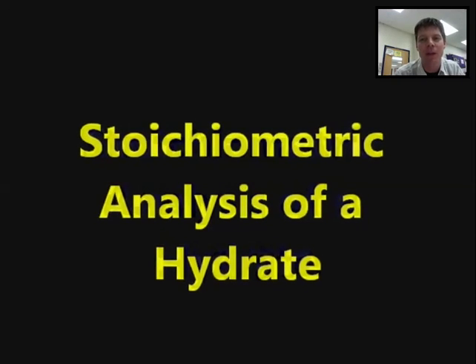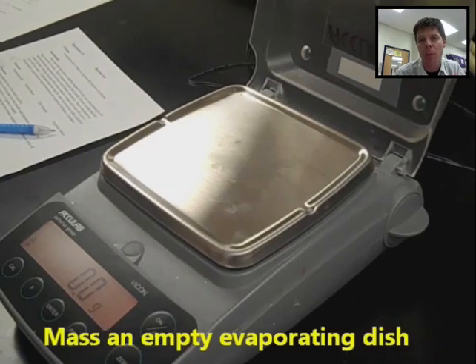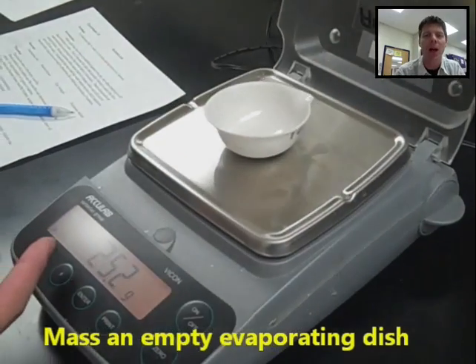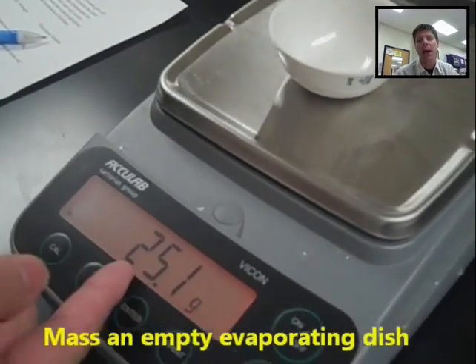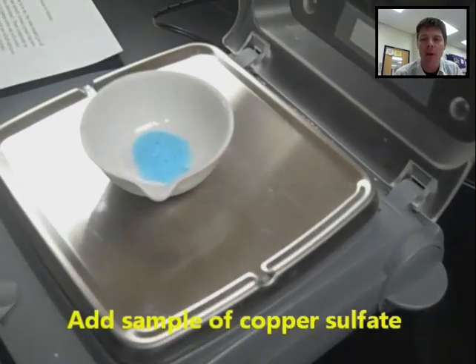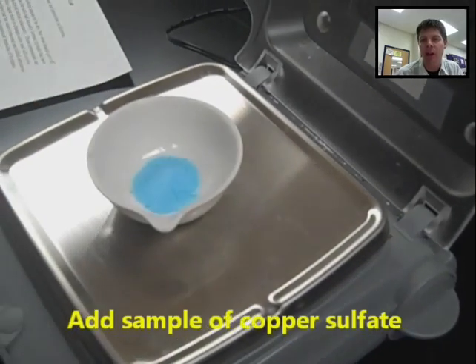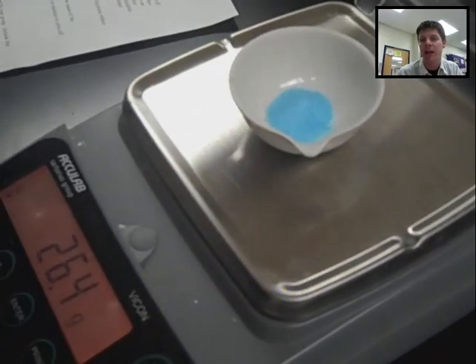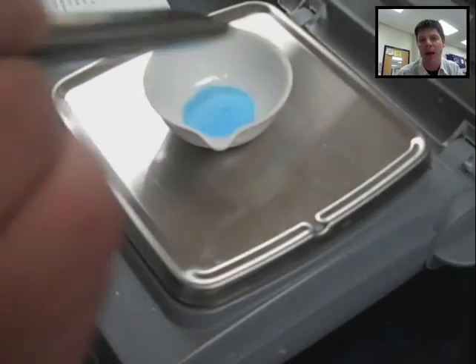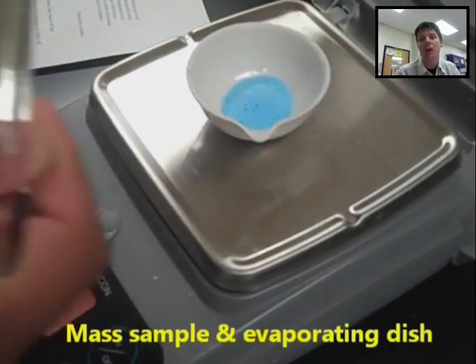Hi everybody, this is a video of a student experiment to do stoichiometric analysis of a hydrate compound. The hydrate the students were working with for this lab was copper sulfate. You can see that the sample is being added into an evaporating dish which has been massed to determine the mass of the empty evaporating dish.